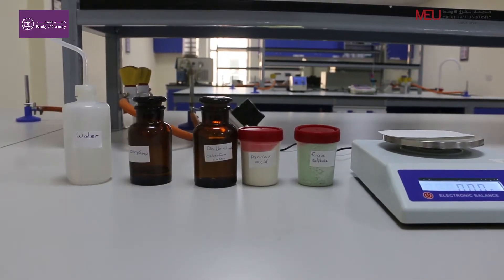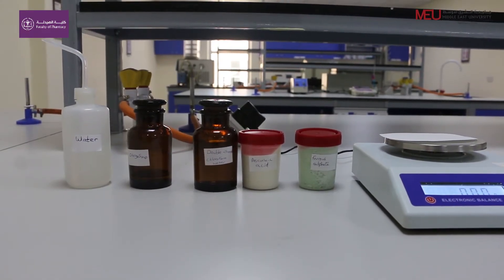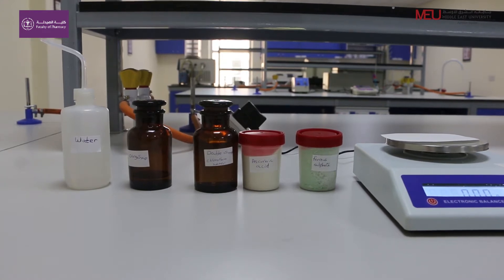How to prepare 50 ml Pediatric Ferrous Sulfate Oral Solution, which is used as a hematonic agent.